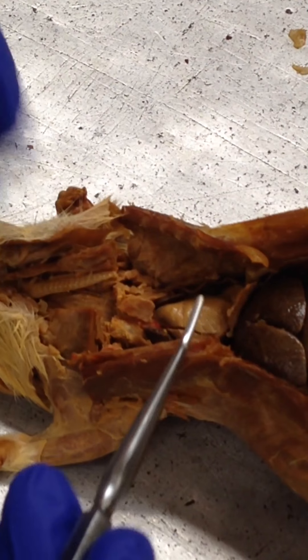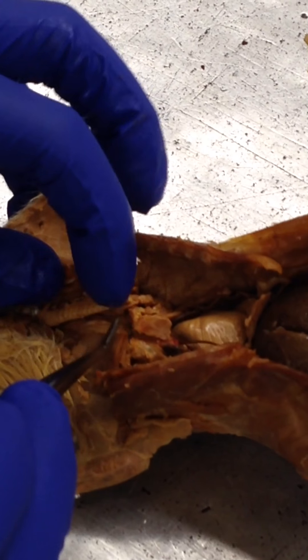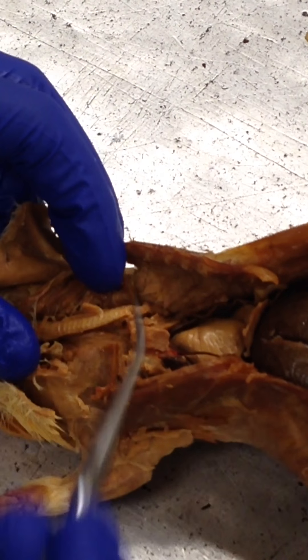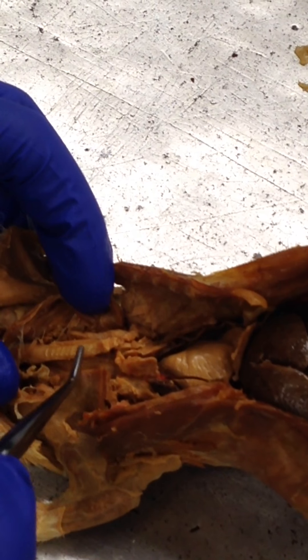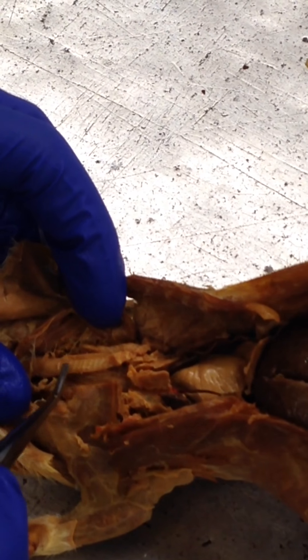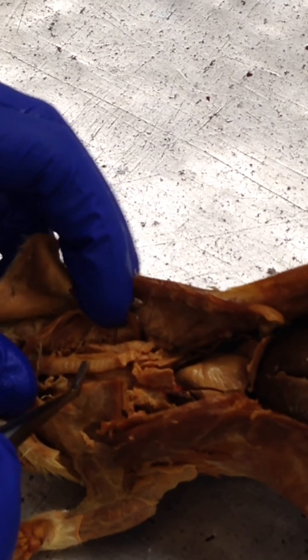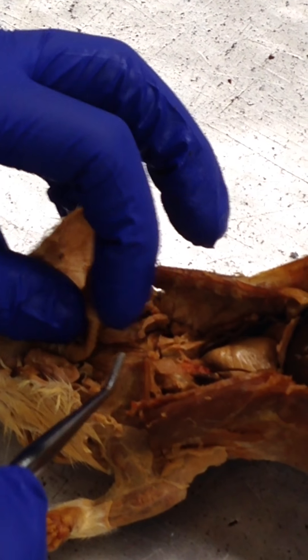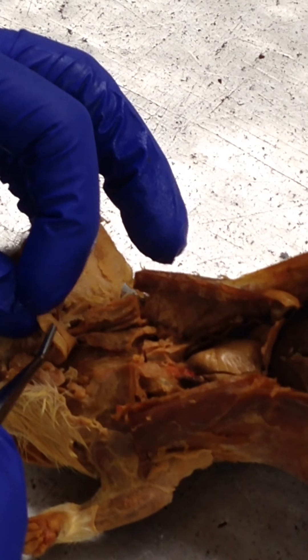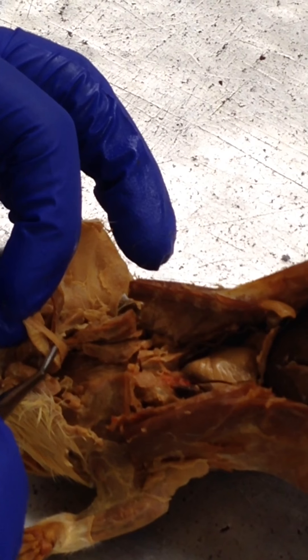The trachea is going to be this structure — it has lines going down. And then the esophagus is right under it — it's this one here.